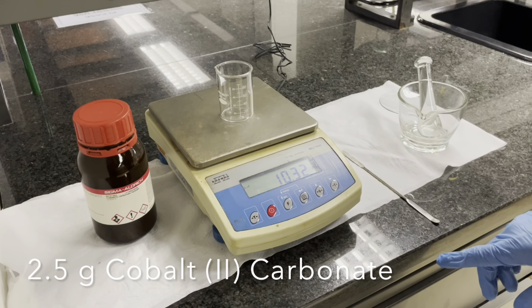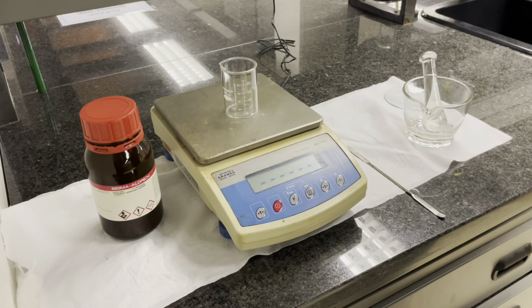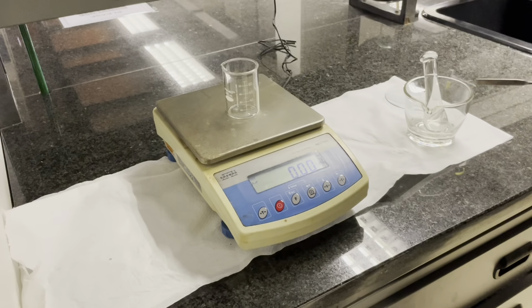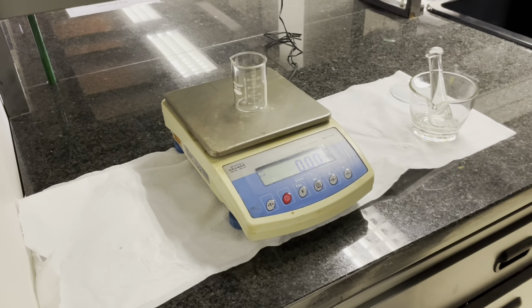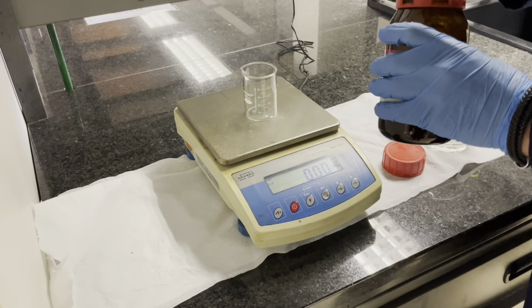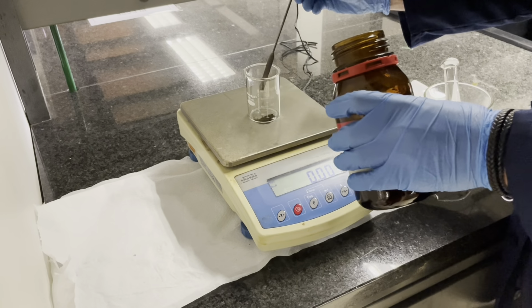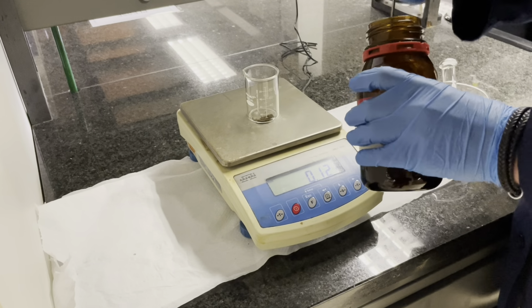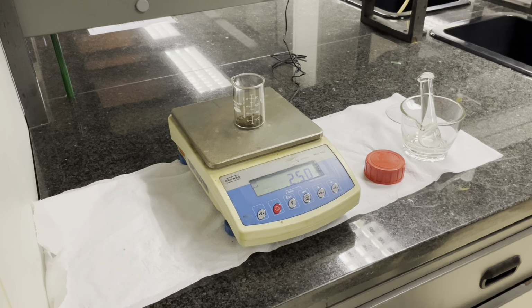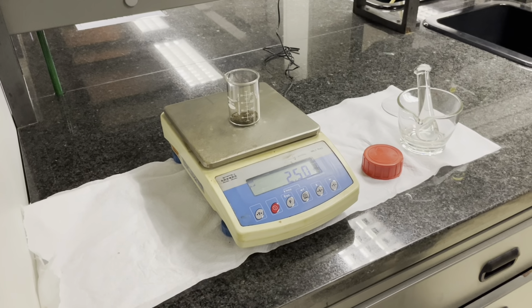Next, in a small 100 ml beaker, collect your 2.5 grams of cobalt carbonate, CoCO3. First, tare the scale using your 100 ml beaker and then carefully weigh off your cobalt carbonate. Remember, this mass only needs to be approximately 2.5 grams.